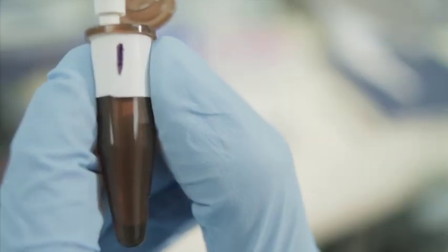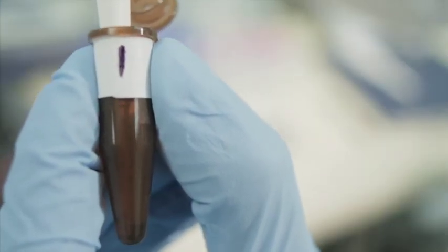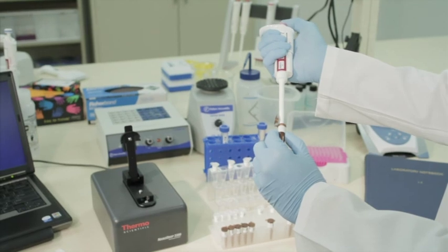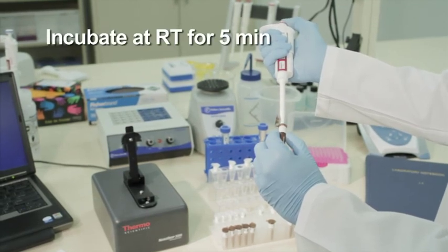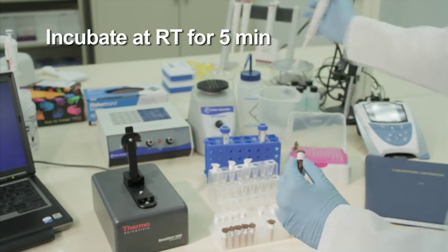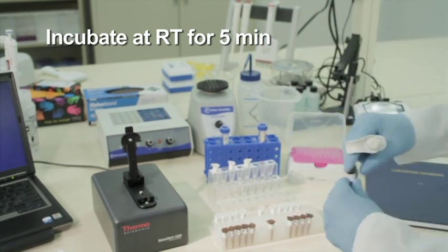Mix the contents of each tube thoroughly by gentle pipetting and allow to incubate at room temperature for 5 minutes. All standards and samples should be equilibrated to the same temperature before measurement as fluorescent signal is affected by temperature.